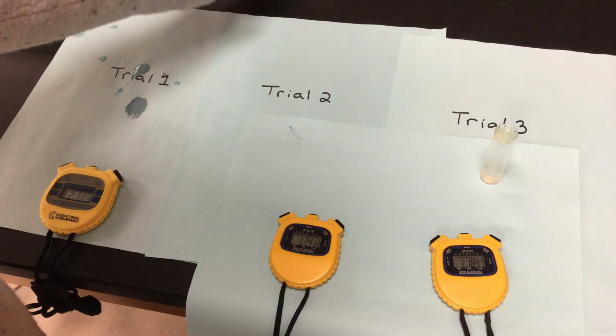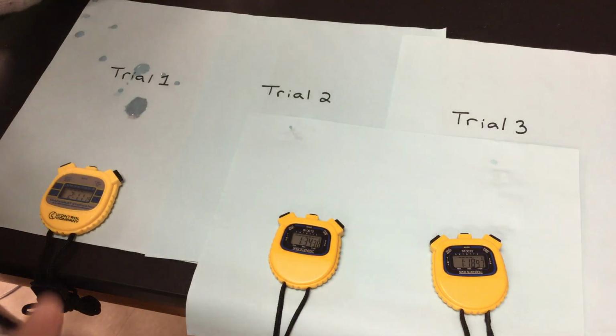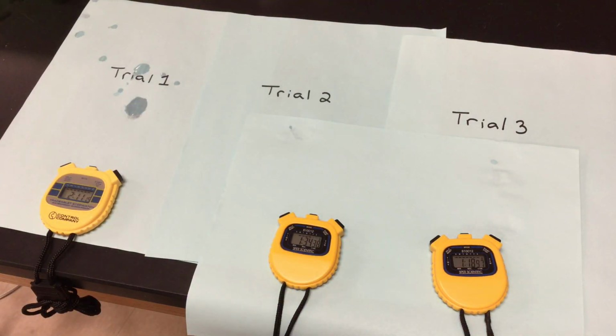And now we want to check a pH of 11. So now we're going super basic on that far end there. And I want to fill it up with my pH of 11. So it's got some hydrogen peroxide in it, and it's got some sodium hydroxide to make that particular pH.